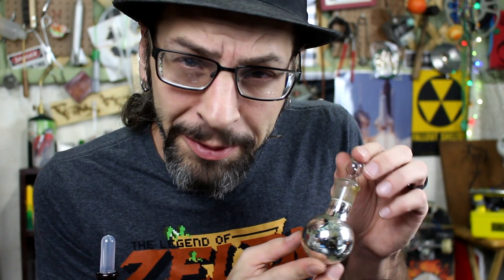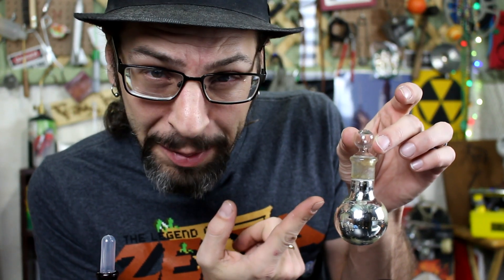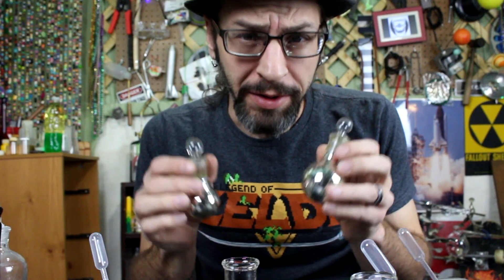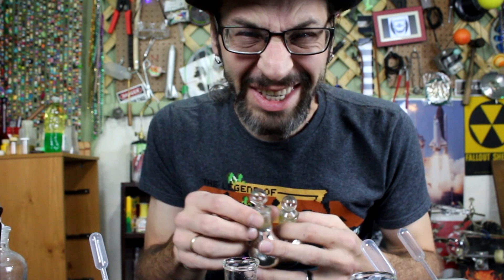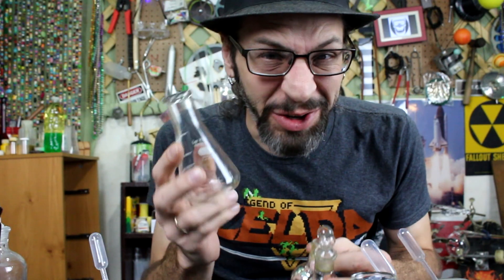I think we're going to have to find a way to hang these and put them on the tree. I should probably not hold that by the stopper because it comes apart. These are pretty awesome and I'm thinking they're going to look really good on the Christmas tree, but I also think we need to go a little bit bigger. We're going to try it with a flask.